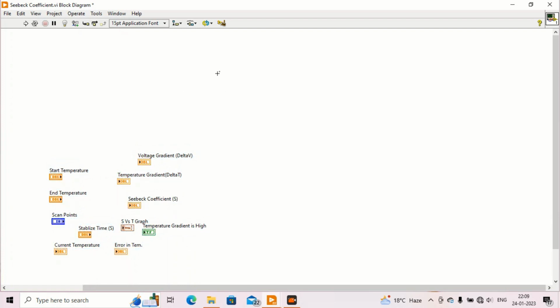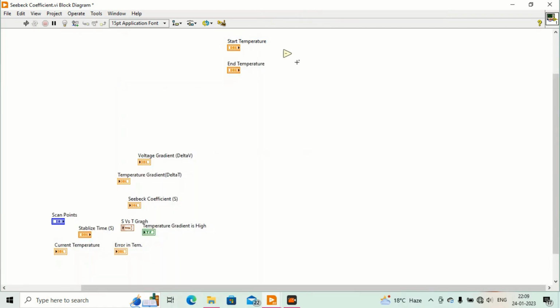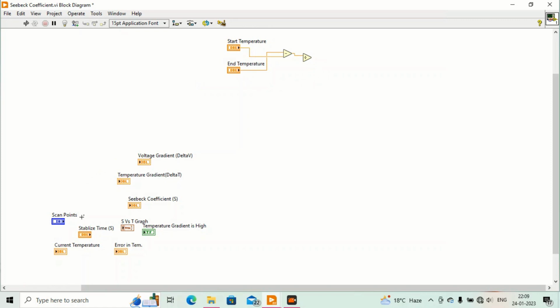Now I will create things for temperature control. For this I will take start temperature and end temperature, and on numeric let's subtract. End temperature will always be higher than the start temperature, so we will put it in the first place, and the start in the second. Now take divide, and it will be divided by the number of scan points.